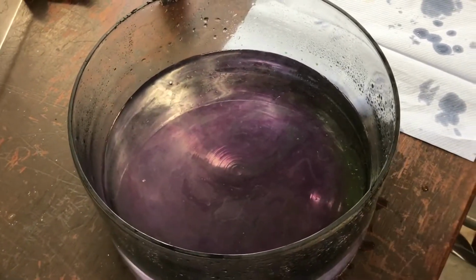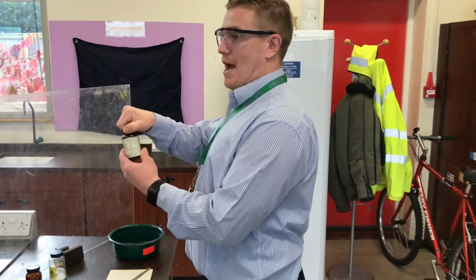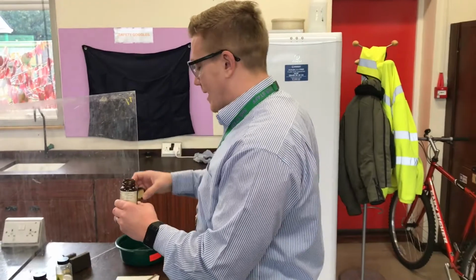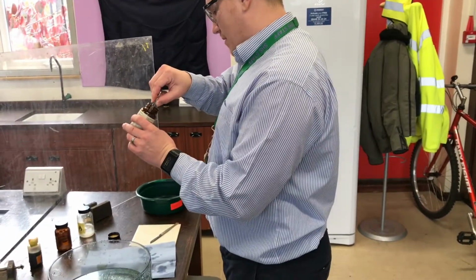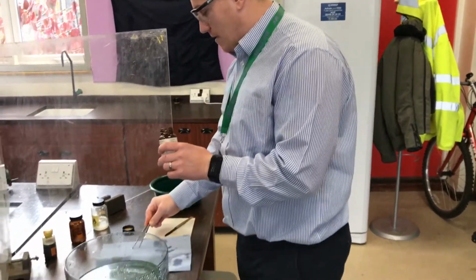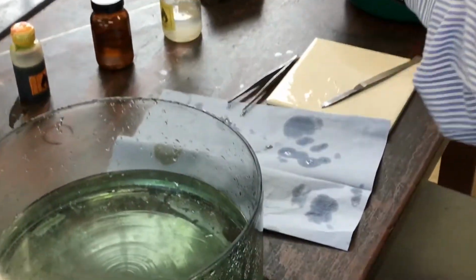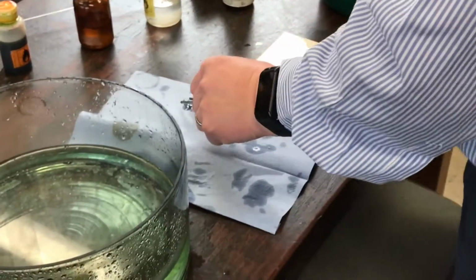We're going to work on what you predict is our most reactive, potassium, because you said it was lower down in the periodic table, which is good. I'm going to use a very small amount because I do get told off for using a lot of this all the time. It's expensive and also very reactive. I'll start with a small amount. We'll see how it goes. Anyone want to make a prediction about what we're going to see?